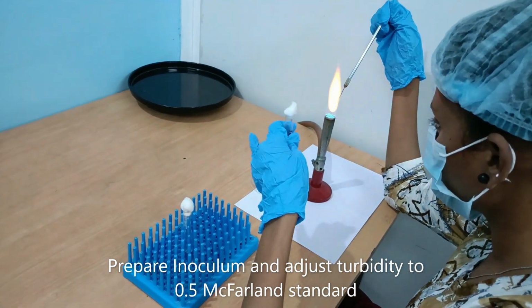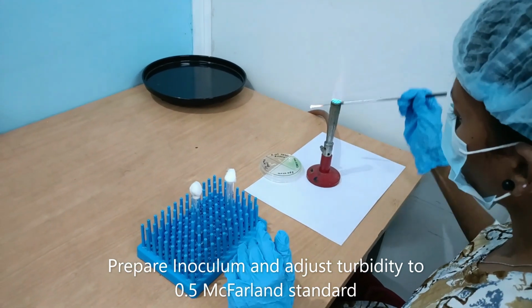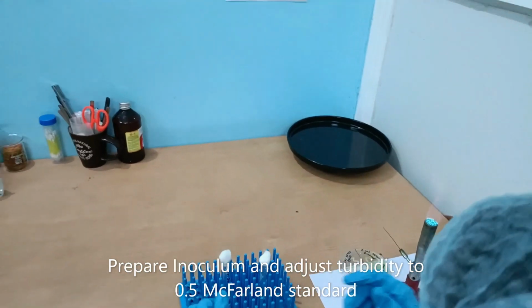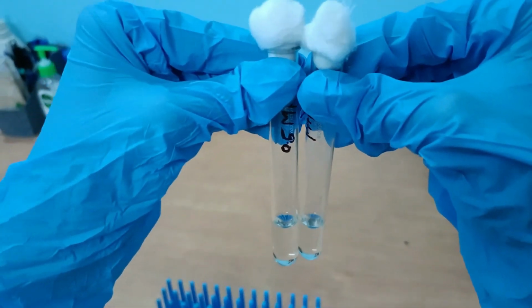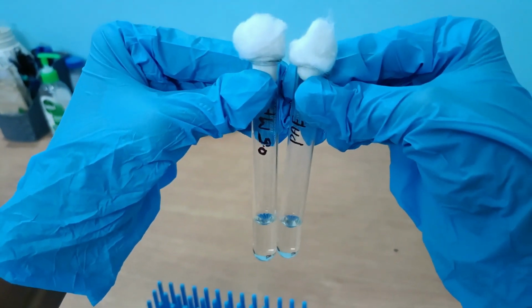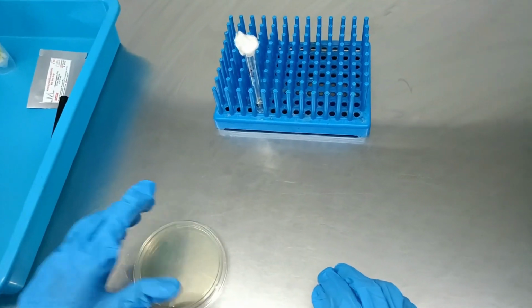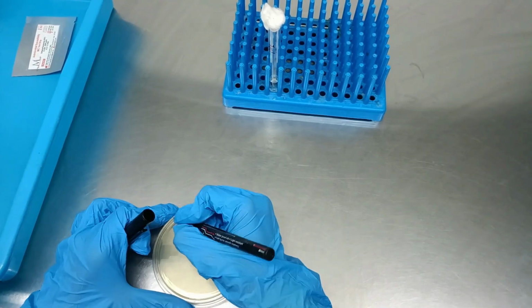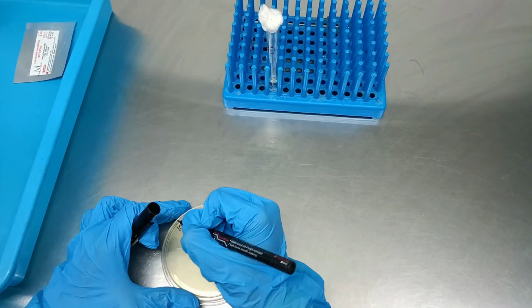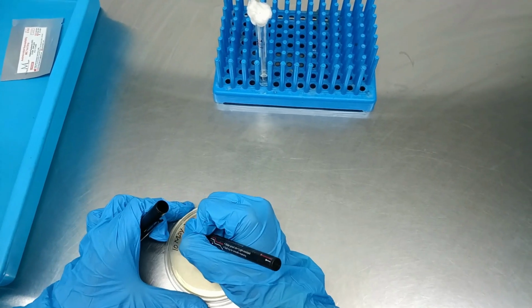Adjust the suspension to match 0.5 McFarland turbidity by adding either more colonies or diluent as needed. Take a pre-dried sterile Mueller-Hinton agar plate into a sterile workspace. Label the bottom of the plate with relevant information like date, sample number, or organism name.